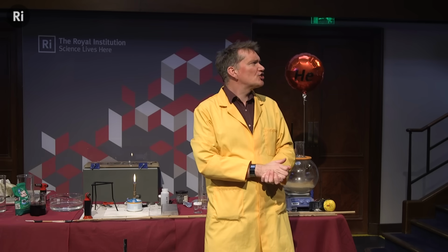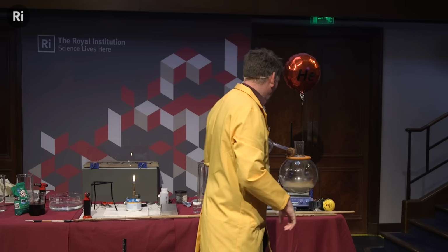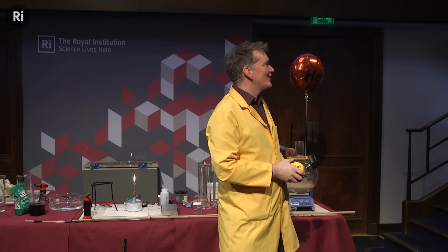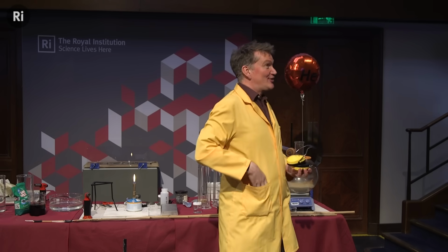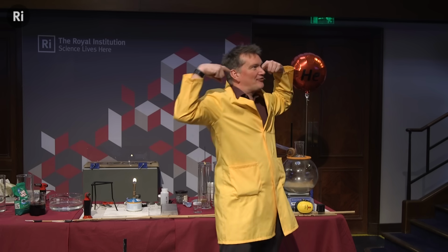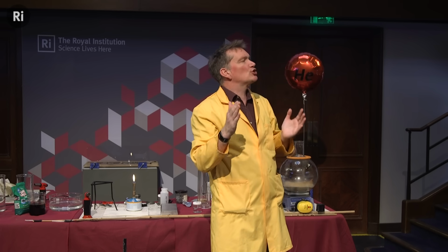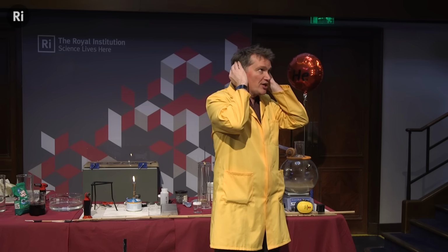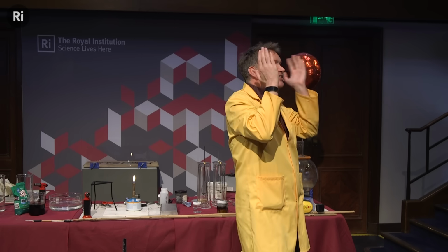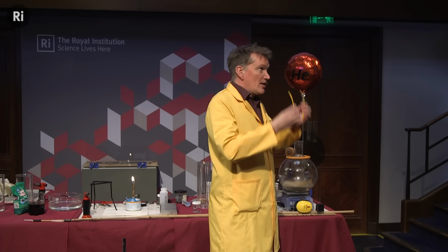And it is quite a sharp explosion. So I will be wearing these ear defenders, and this is always a good sign. When you see the lecturer wear ear defenders, you really do need to just cover your ears. Now, you won't need to stick your fingers in your ears, just put your hands over them, and this will stop the shock wave, which could otherwise, if you're particularly close, damage your ears. So just cover them. You don't need to cover them really tightly. Just put your hands over your ears. Okay, so let's give it a go.